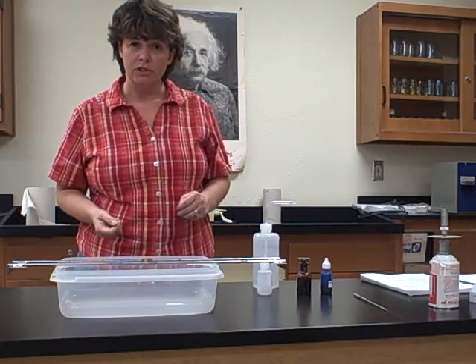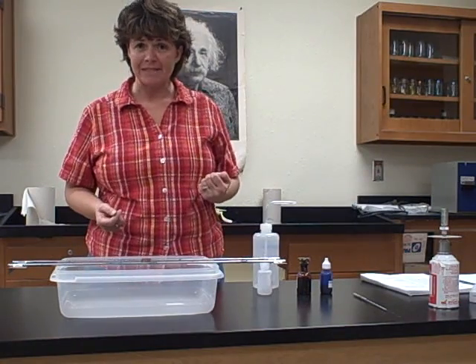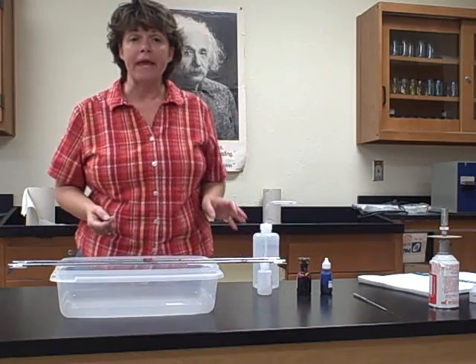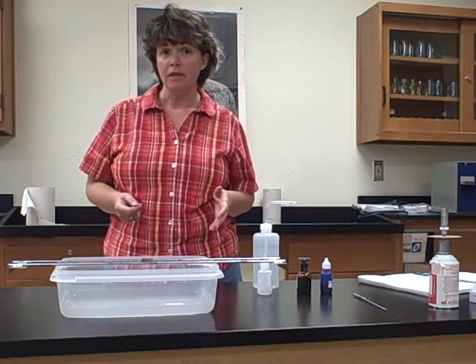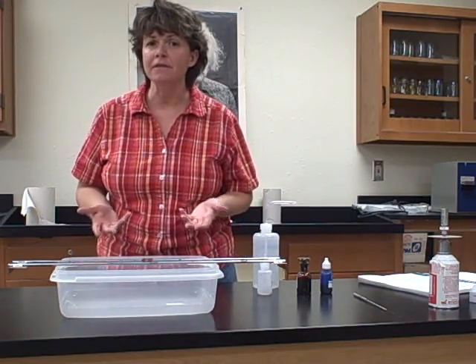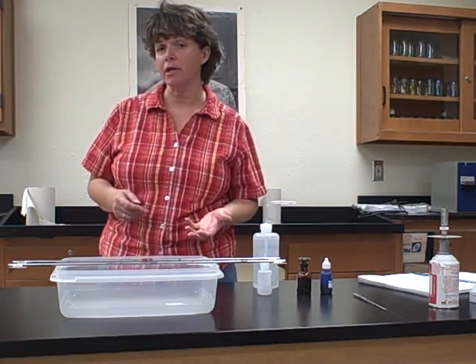So the first stain that we're going to do is the acid-fast stain. This one begins on page 41. Now, some bacteria, like the bacteria that causes tuberculosis and leprosy, are examples of bacteria that are acid-fast. That means that even when they're washed with acid, they're still going to retain their primary color.